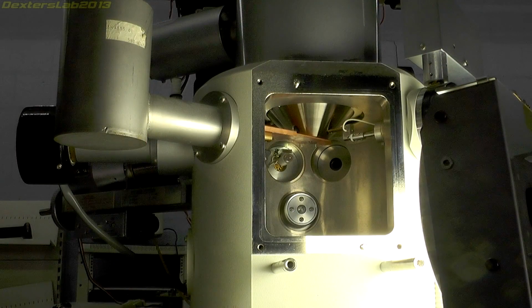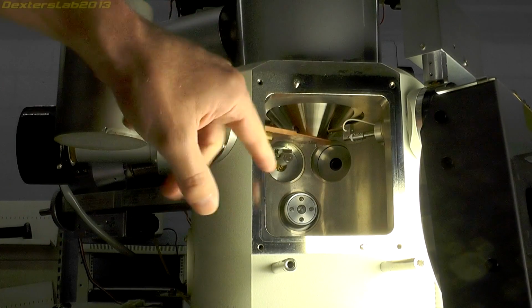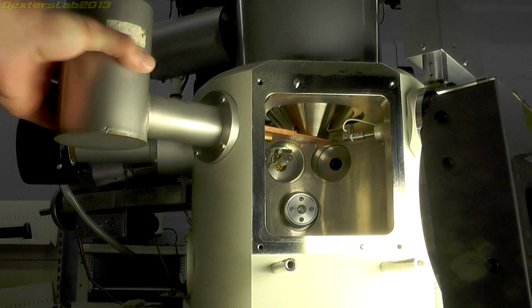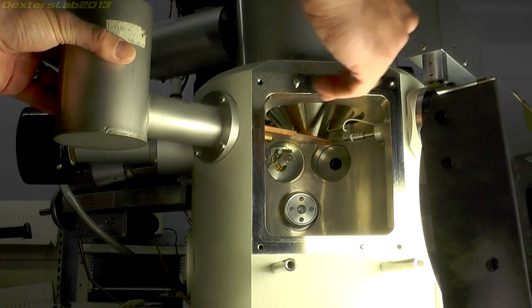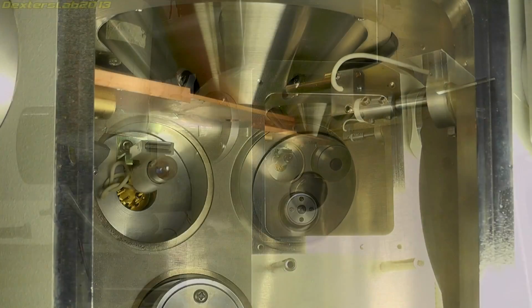If we just take a look at the sample chamber now, we have this device on the outside. This connects through onto the inside. I'll show you what's on the inside in just a moment. This is a small dewar. It's normally filled with liquid nitrogen. There is a copper bar which runs all the way through into the sample chamber and connects to a copper plate, and that is acting as a chiller.